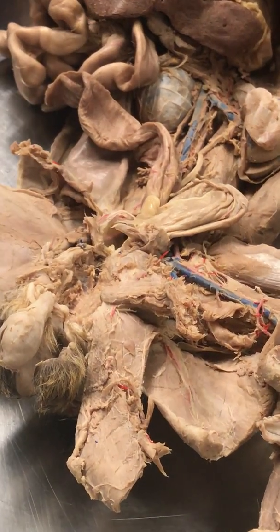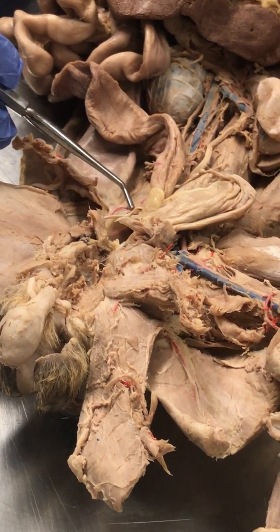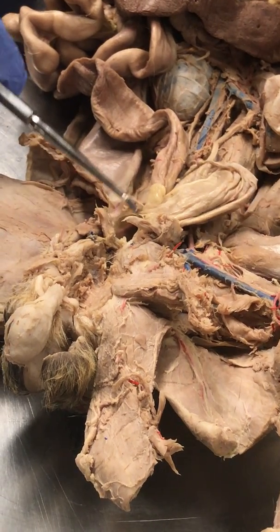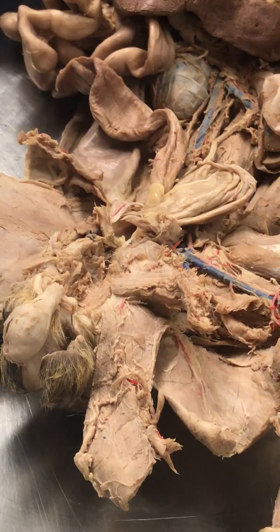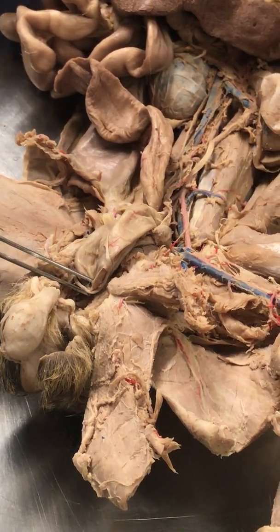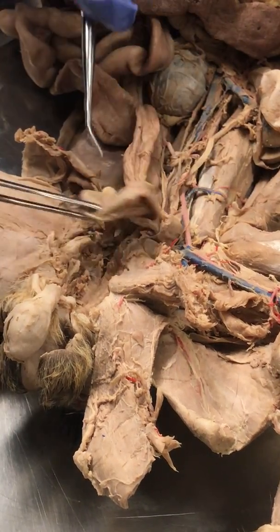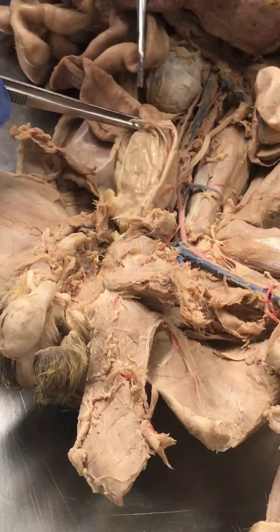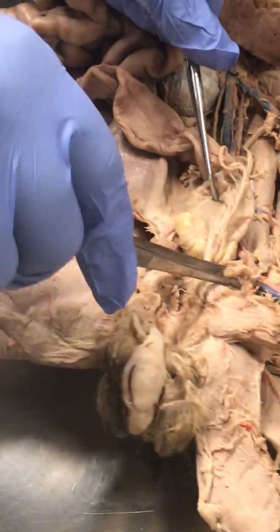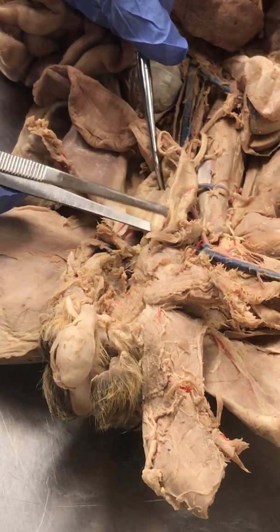If we follow that here, we get to see another structure. This thing here, that is the vas deferens. See, this is a cat vas deferens that is going behind the bladder. This is the bladder. It's going behind. See? Right there and right there. There and there. They're going behind. Which means that this tube you see here, that is the urethra.